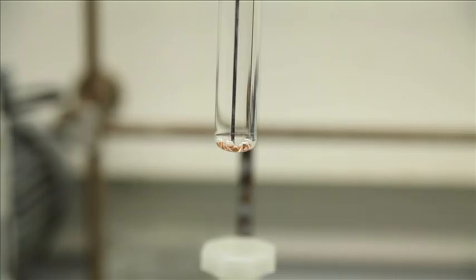So when it gets to A level, it makes sense to show students that copper will actually react with some acids. In fact, its reaction with nitric acid can be particularly impressive, as we'll see here. There's more to an acid than a bunch of dissolved protons, after all.